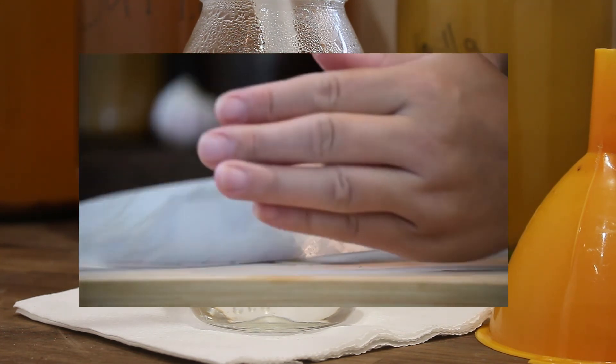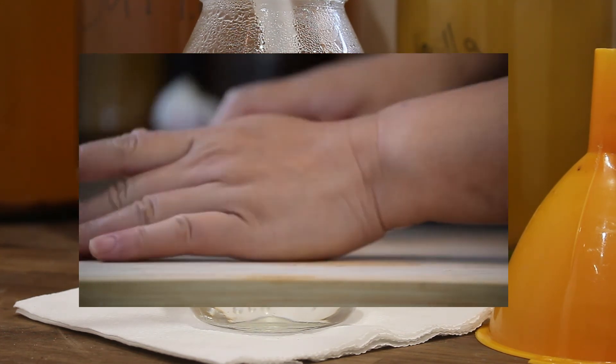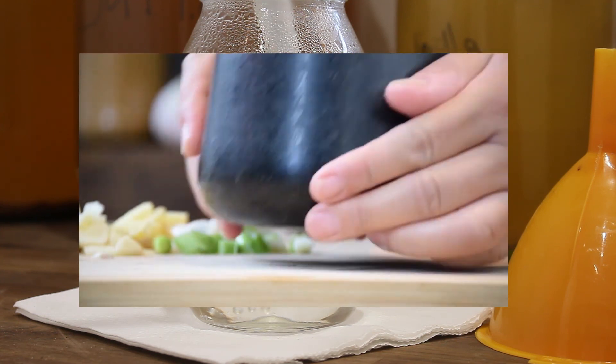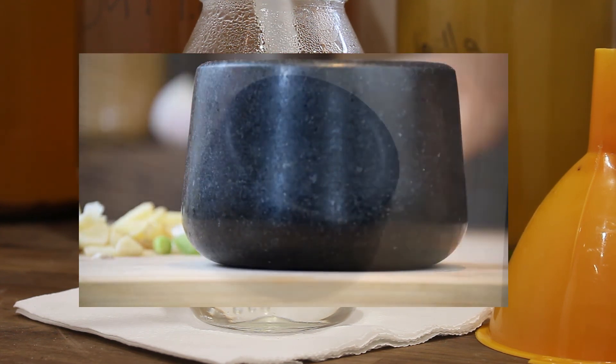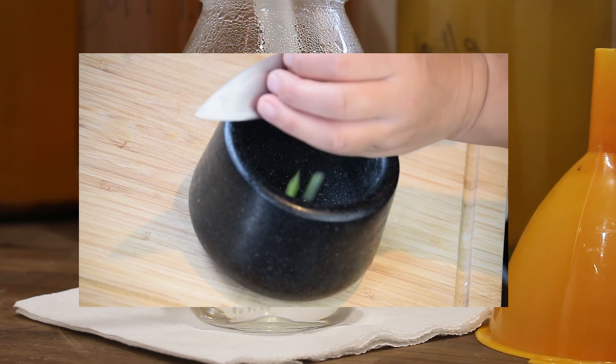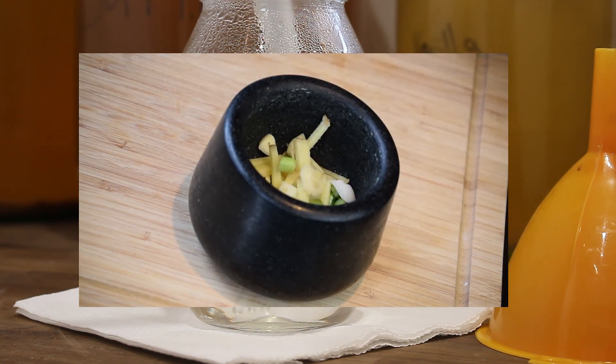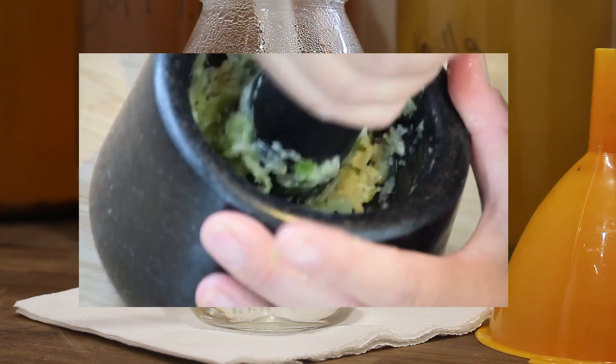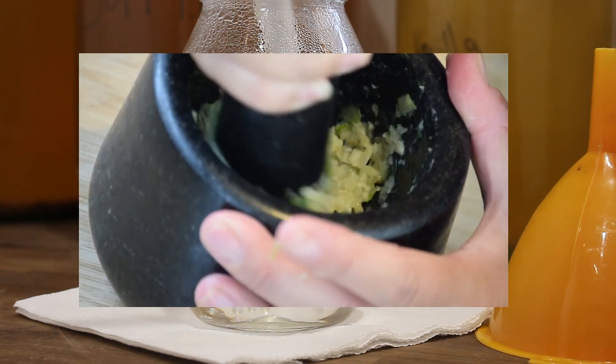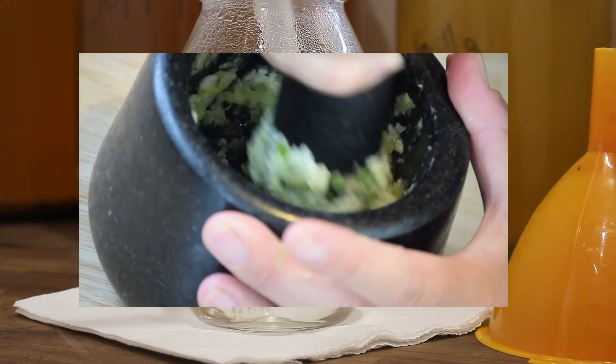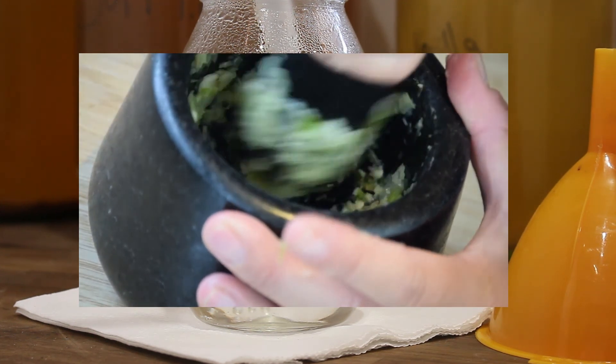Try and maximise the amount of surface area of what you're working with. This means, once you've dried your original material, or if it is fresh, crush it up and make it so that it is the smallest size possible. This means the ethanol will penetrate into it more readily, and draw out those flavours, aromas and so on that you want.